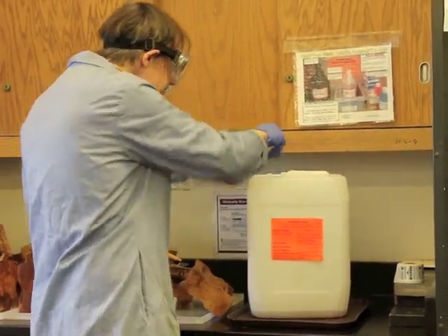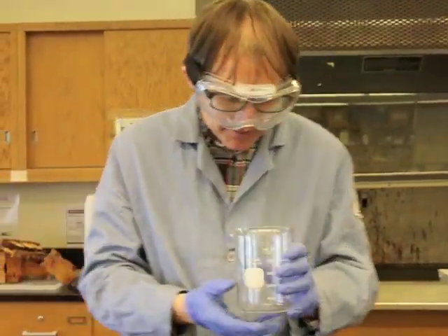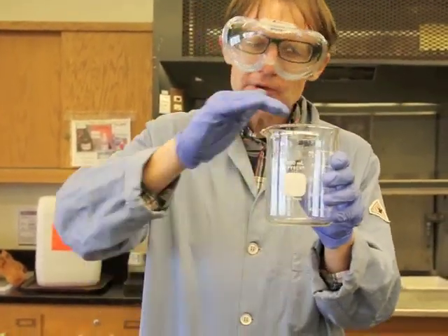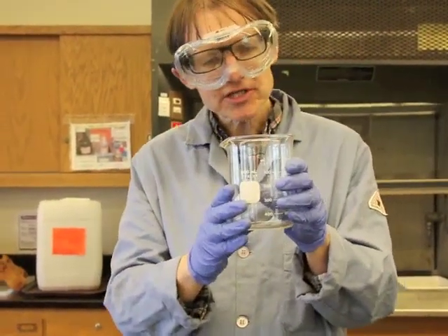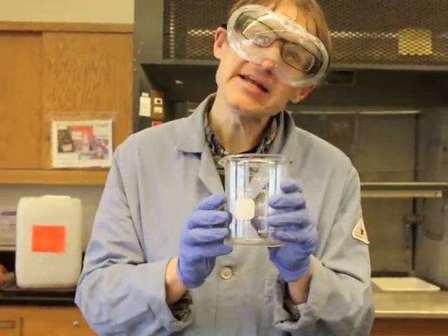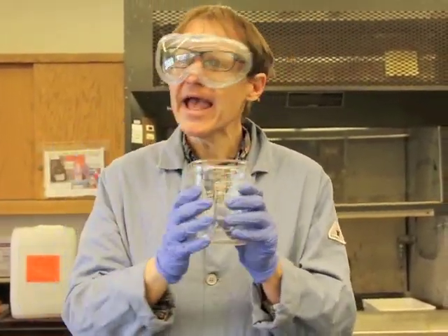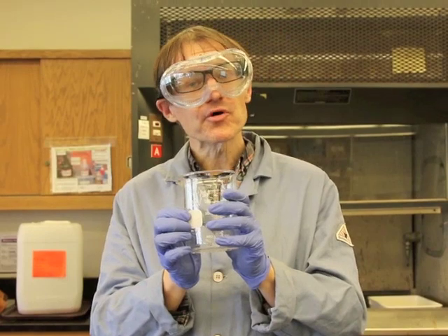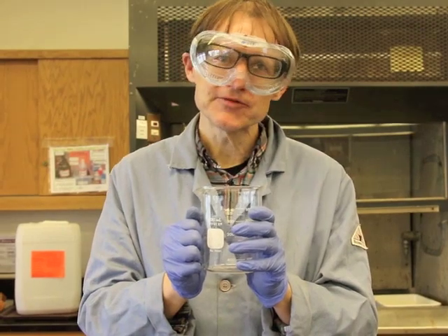And we're also going to note that we're not the only ones using this laboratory. Other people will be using this laboratory, so we want to have chemical hygiene for them. So if this glassware is going to be used by another group, we want to rinse this out. We want to make sure that it's clean and doesn't have any contamination in it. So I won't show this on this video, but we would also rinse out all of our glassware. We would make sure that all of the containers that have chemicals in them are capped off. Everything is labeled properly and put away. And any electrical appliances that we're using in the laboratory, such as the hot plate to boil the water, would be turned off and unplugged in order to protect everybody who's in this laboratory.